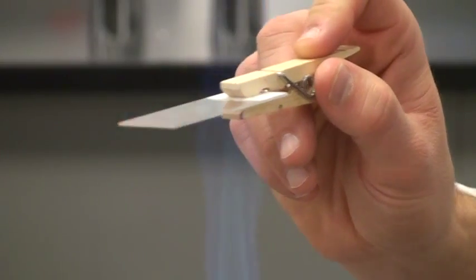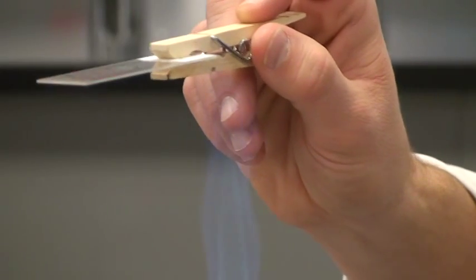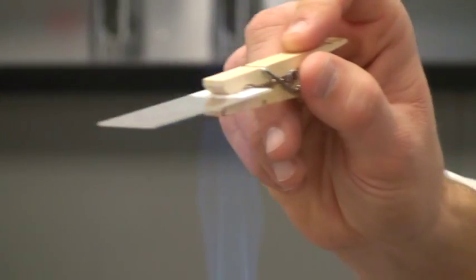Do this 4-5 times. The slide will break if it stays in the flame too long. It also may break if the sample is not completely dry before you heat it.